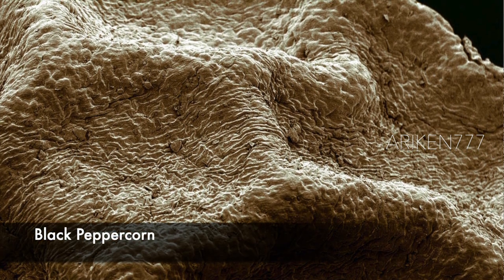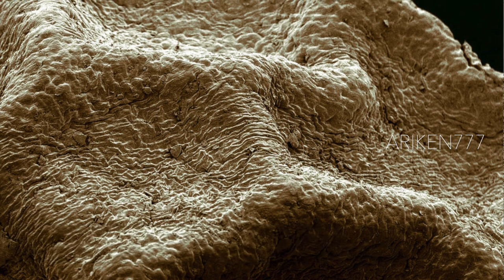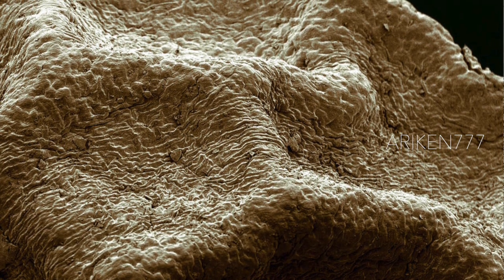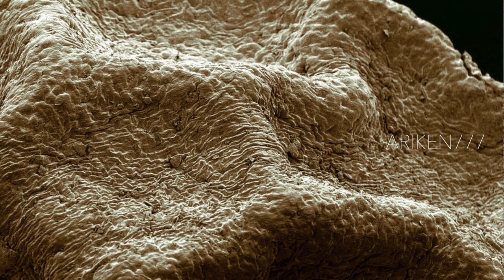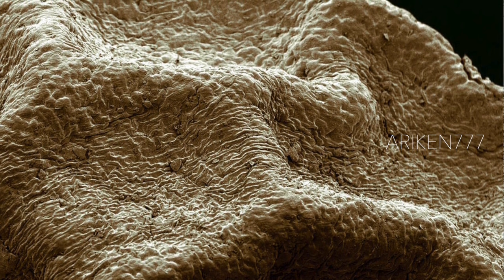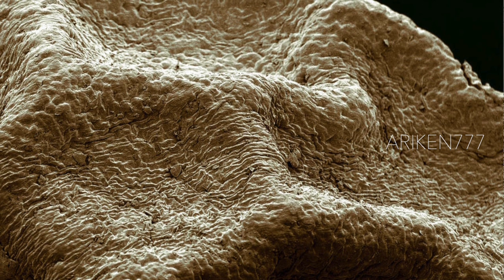The wrinkled surface of a dry black peppercorn. The bite of black and white pepper is caused by an alkaloid piperine. The black color is the result of browning of the peppercorns caused by a fungus, Glomerella cingulata.